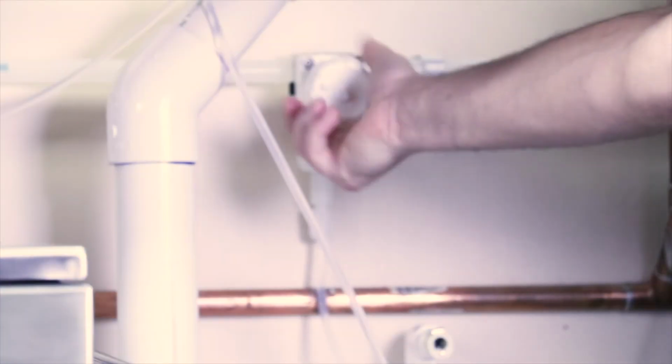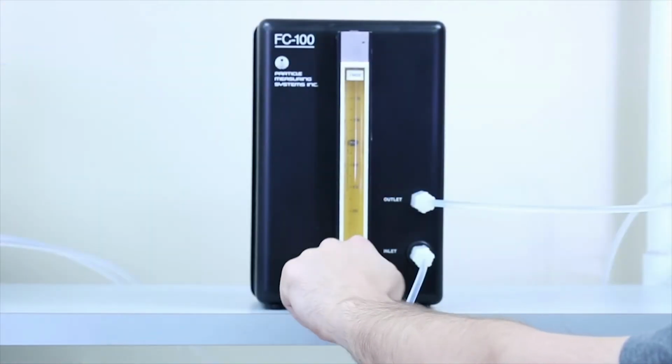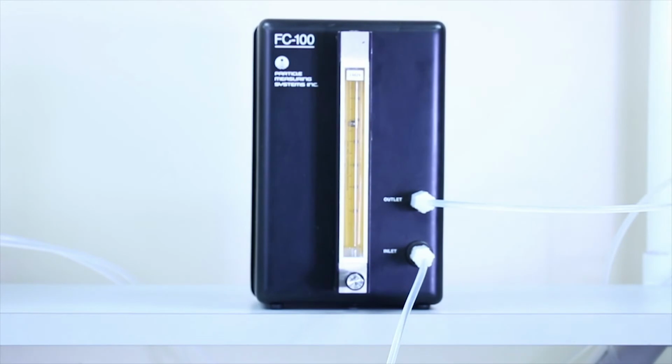Turn the water supply back on and increase the flow to 1,000 milliliters per minute, then cycle the flow as in the previous step. Return the flow to 1,000 milliliters per minute for several minutes.